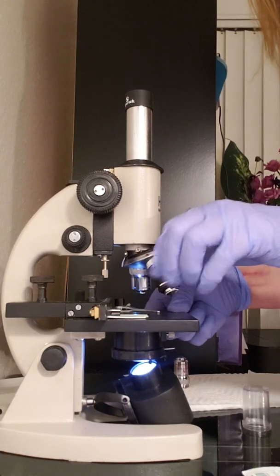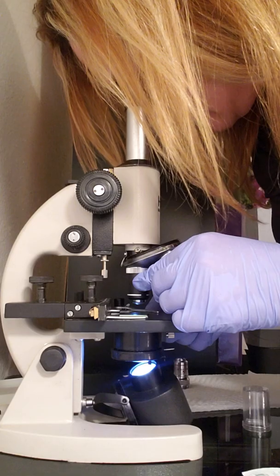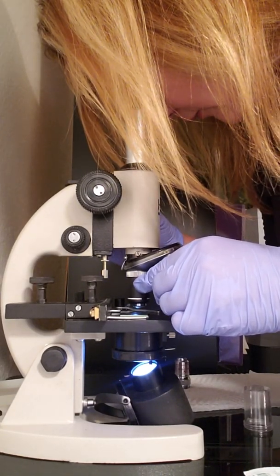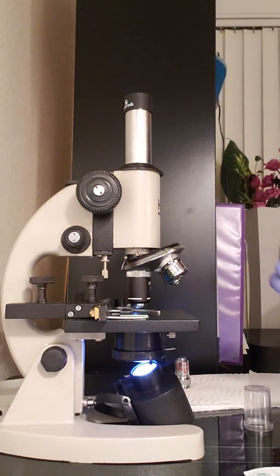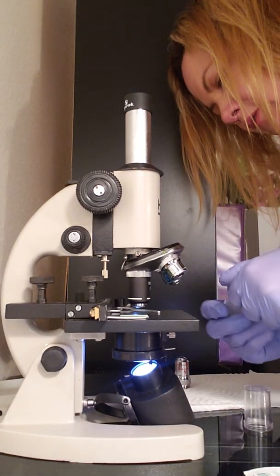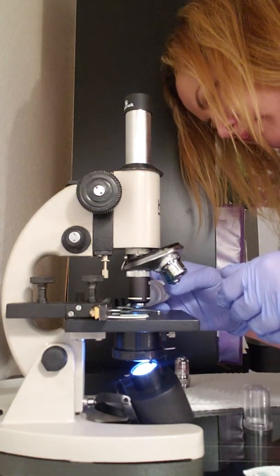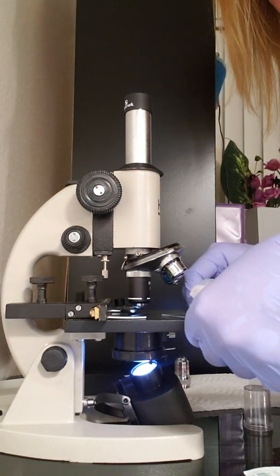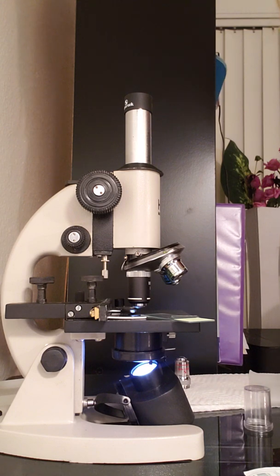So I'm going to turn it like this. Okay. And you have to readjust this one as well. Wow, you get a really good view, like I said. So it's 100 power. And you can put a drop of the oil there too. So I'm going to take this out, put a drop, and then that's how you would do it. And that's just for the cheek.